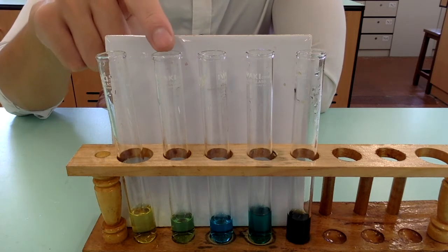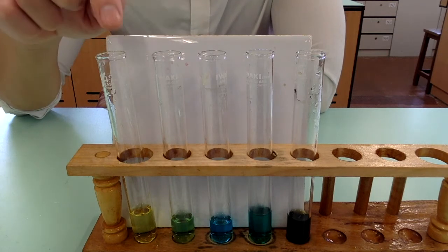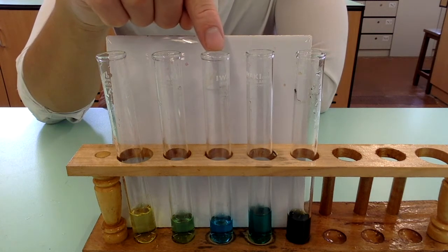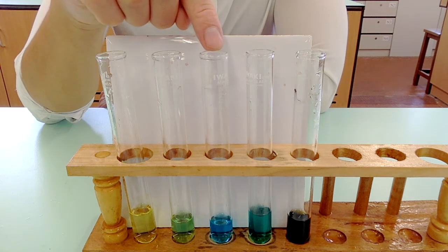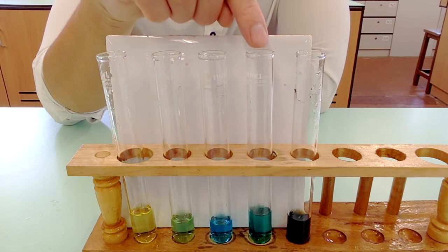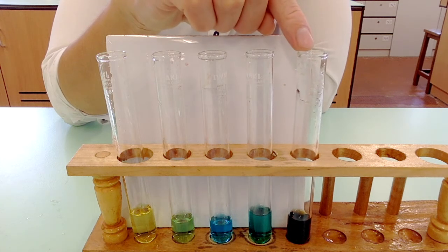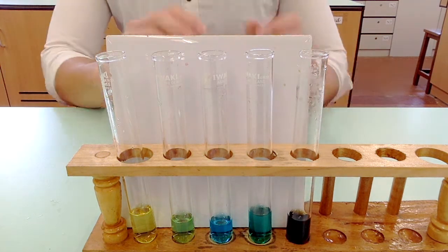Moving to the first color change: the green color is actually the result of the combination of yellow dioxo-vanadium(5) ion and the blue oxo-vanadium(4) ion. This blue solution shows the mixture contains mainly oxo-vanadium(4) ion, oxidation state +4. This green solution shows V3+ as the majority species. And lastly, this is vanadium(2) ion, oxidation state +2. So: +5, +4, +3, +2. That's the end of Part A.